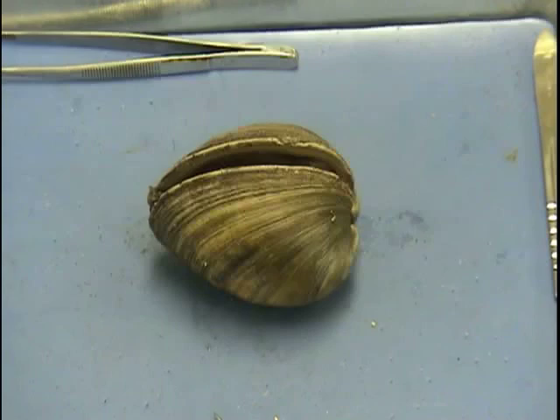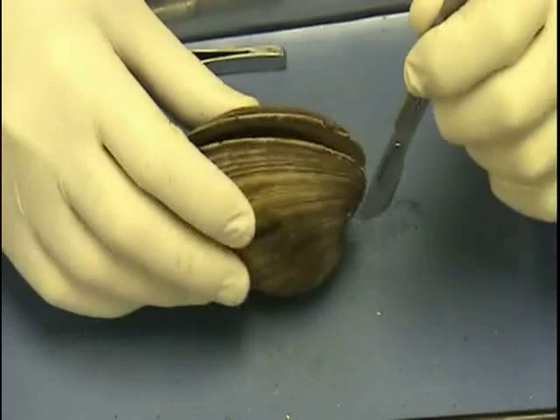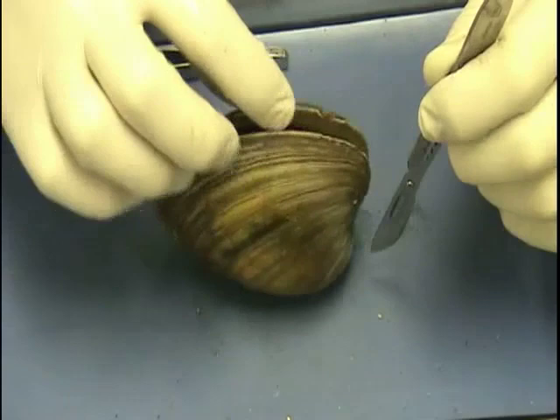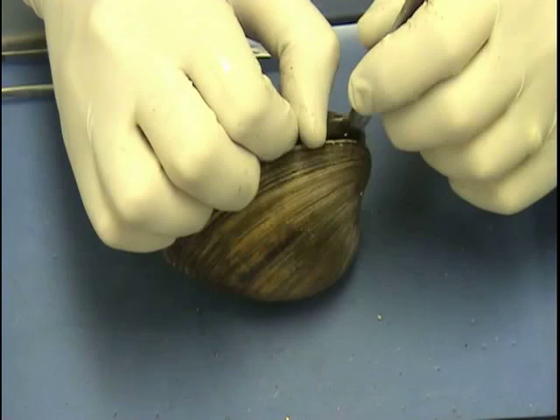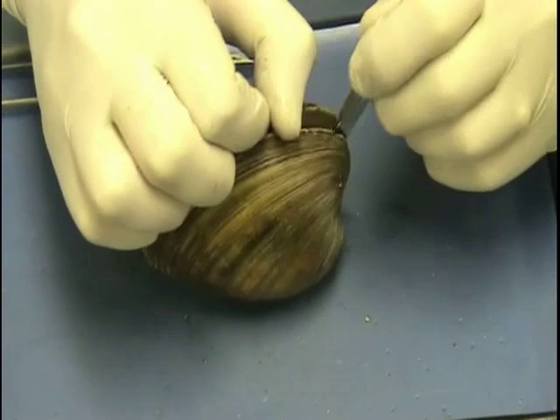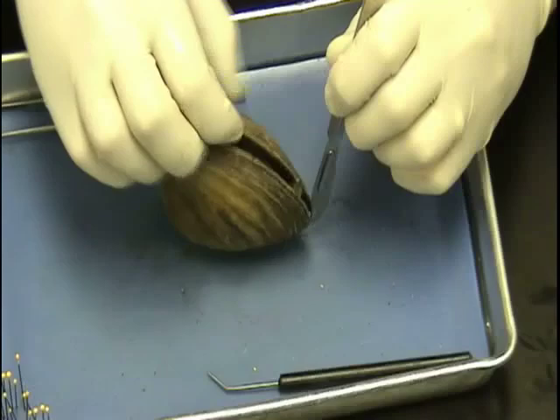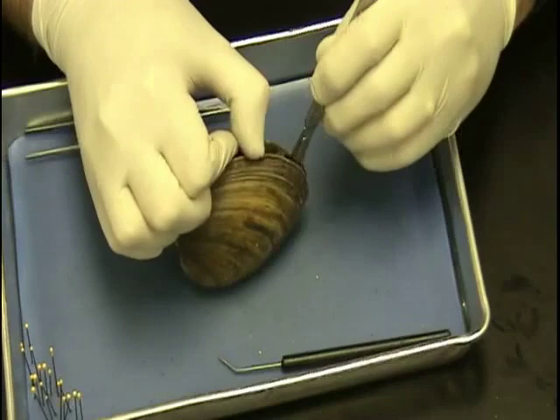We want the clam to have the ventral side up. We want to grab the scalpel, and we want to be very careful as to how we're holding it. When we're cutting here, we're going to go straight down and make sure we cut the two muscles there. There are two adductor muscles — muscles that bring the clam, the valves, together. So I'm going to put my fingers right at the top here, carefully put in the scalpel, and I can feel the muscle right here — it's called the adductor muscle. I'm going to put a little pressure there and cut, feeling the muscles right down there.